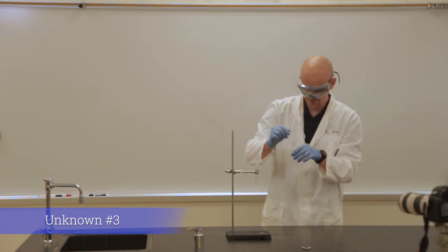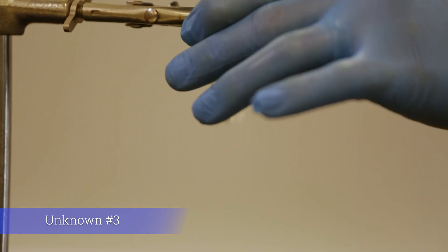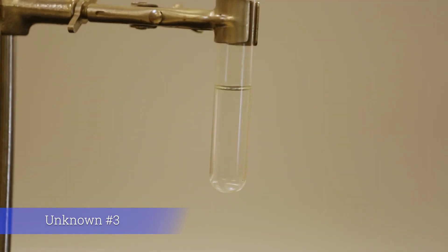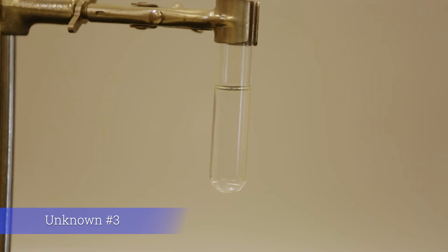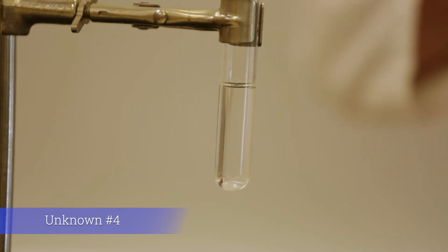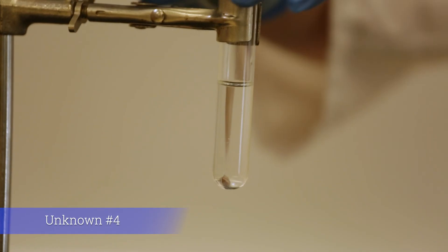I'm going to add a couple drops of our next unknown. I'll give this a little bit of a shake. It looks fairly consistent throughout — so it looks like everything in this case has dissolved. And for the fourth unknown, I don't see any different layers here — it looks like it has combined.